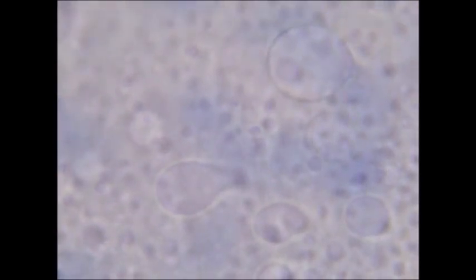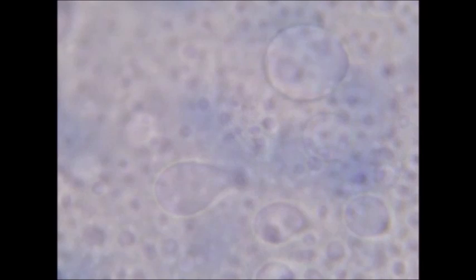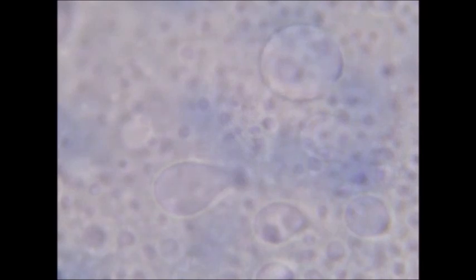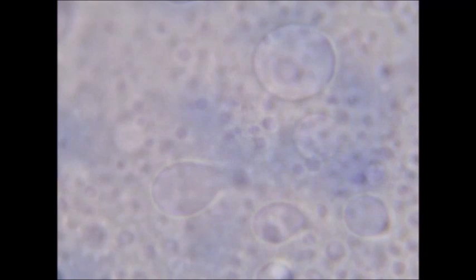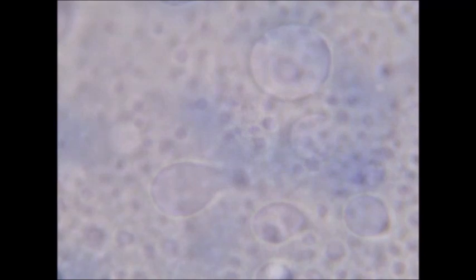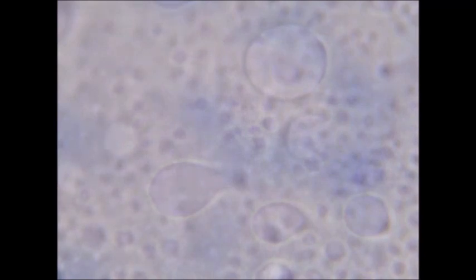And lastly, what we have here is the only instance I was able to capture of a vesicular spontaneous division, where the vesicle on the left is pinching off and creating a smaller one on the right.